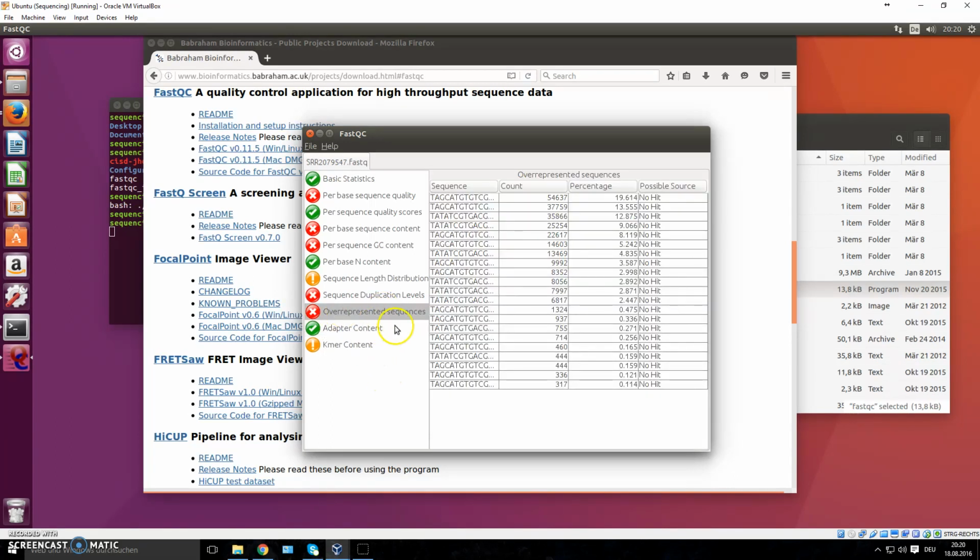But you have, for example, overrepresented sequences. Why? What might this be? This might be adapters, but because we know there are no adapters left here, unless you used some custom-made adapters which are not part of these listed here, then this might be the adapter. Or it just might be that you're sequencing very similar things. If you were sequencing, which this is, by the way, a TCR repertoire, then obviously, for example, the constant region of the TCR beta chain might be overrepresented, because you might have a lot of TCR clones that have the exact same constant region, the exact same variable region. And that's why you can get these overrepresented sequences.